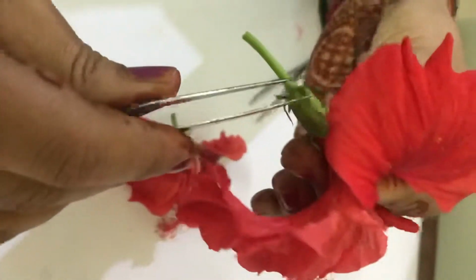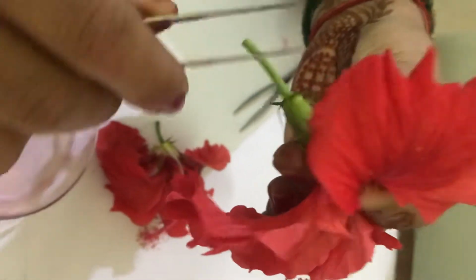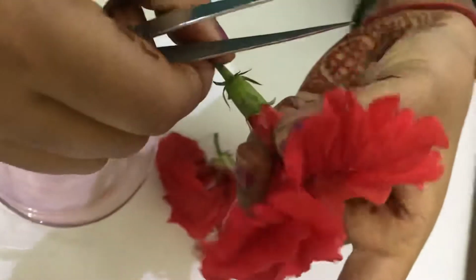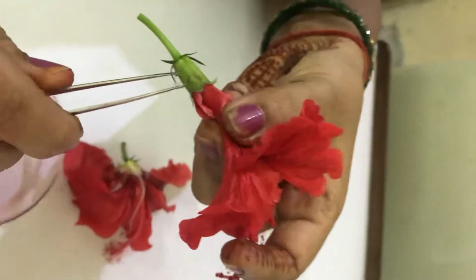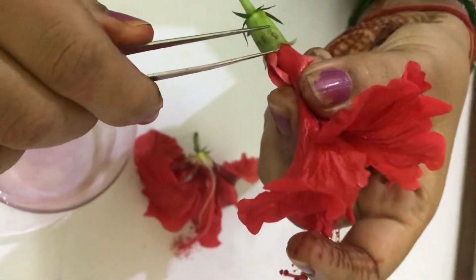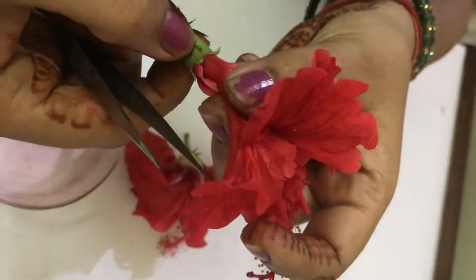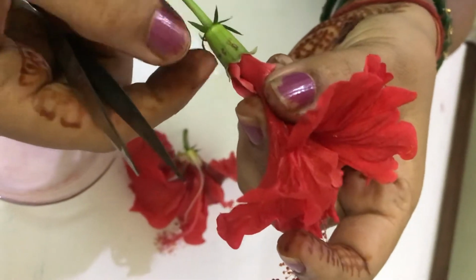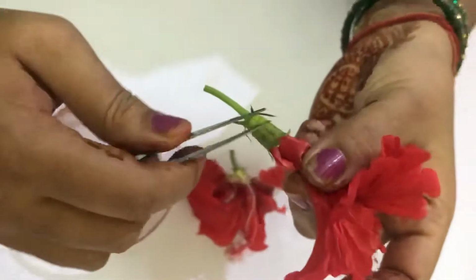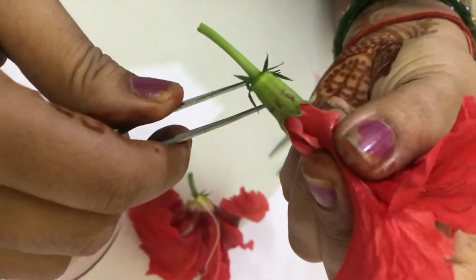Here the epicalyx is present. These green leaf-like structures which you can see are termed the epicalyx. Next to this is again a green leafy portion, which is the sepal. A single one is termed a sepal, and the group of sepals is termed the calyx. The epicalyx is not present in every flower, but in China rose it is present. So the first whorl of the flower is the calyx, the group of sepals.